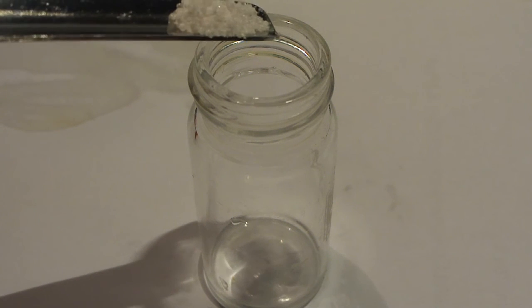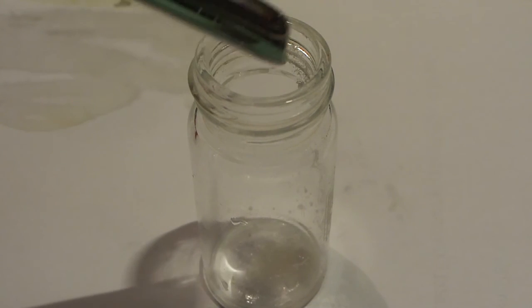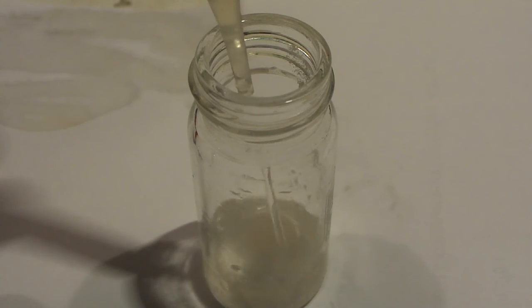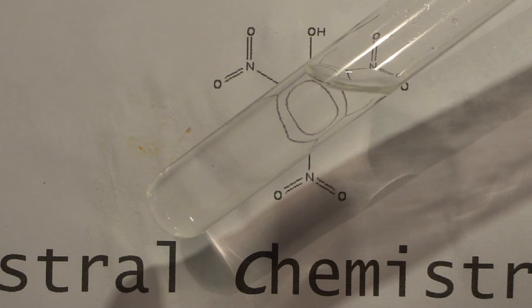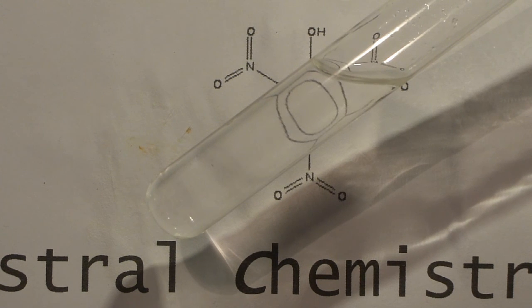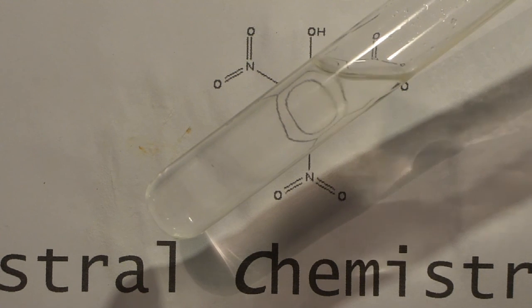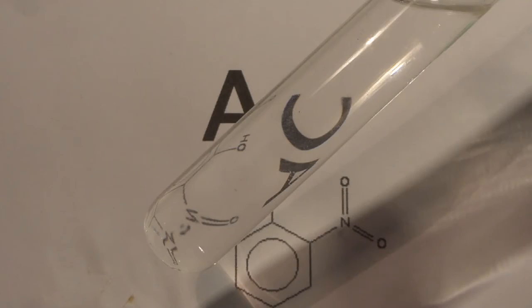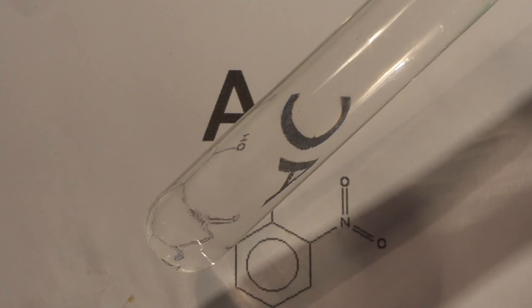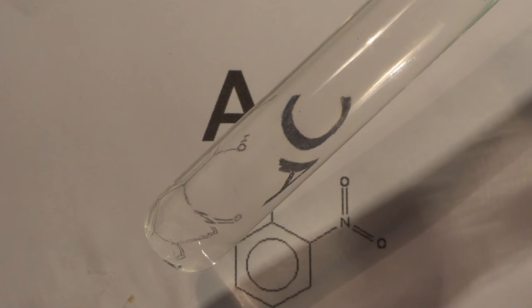Start by dissolving a few crystals of iron(II) sulfate or ammonium iron(II) sulfate in the minimum amount of water. Acidify your test solution with a few drops of a 10% by weight sulfuric acid solution. In this case, we add ammonium nitrate to the test solution so that you can see how a positive test works. Next, add a few drops of your iron(II) salt solution to the test solution. For the next step, hold your test tube at an angle and carefully add concentrated sulfuric acid. By letting the acid flow down the walls of the tube, it sinks to the bottom and forms a separate layer.